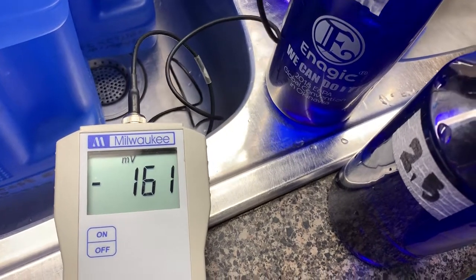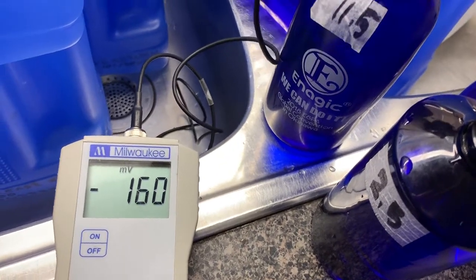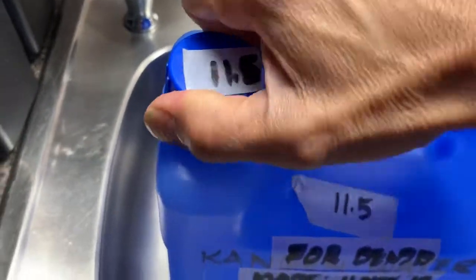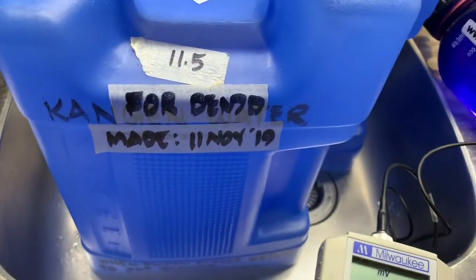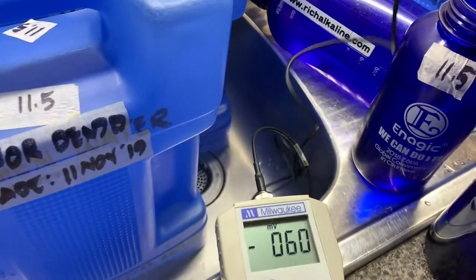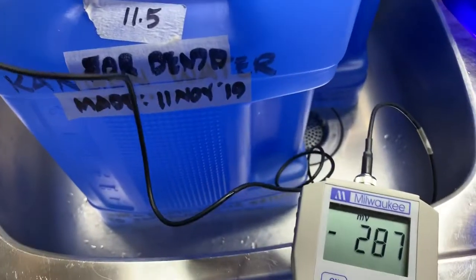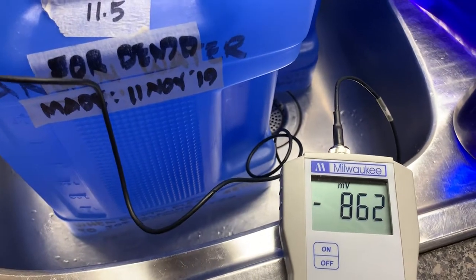This has been exposed for the last few minutes, that's why we'll change this with this one — this one is a fresh batch. Let's open this. This is a new batch that I made, preparing it for a demo today. If it doesn't reach above 800, let's switch to a fresh one. Now see it's jumping already — that's negative 800.